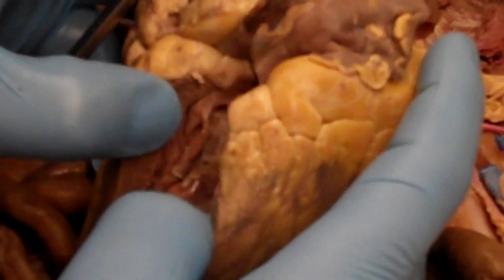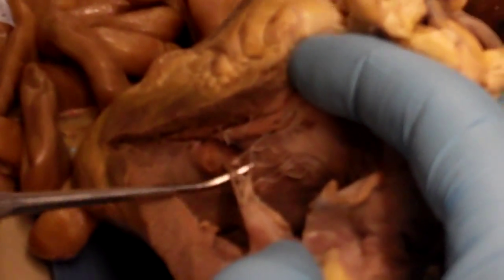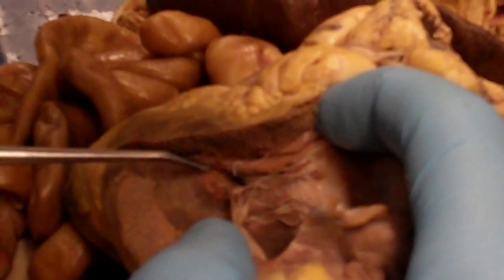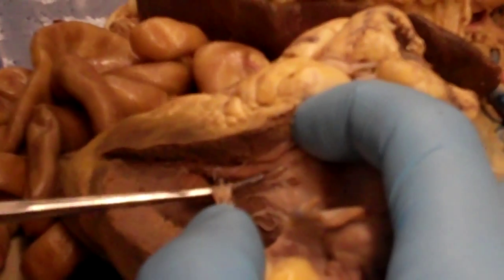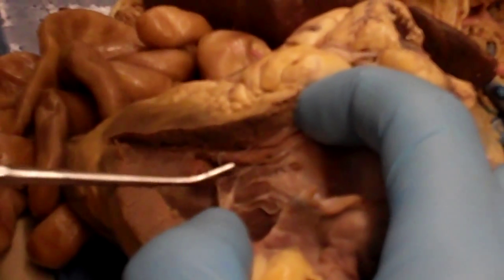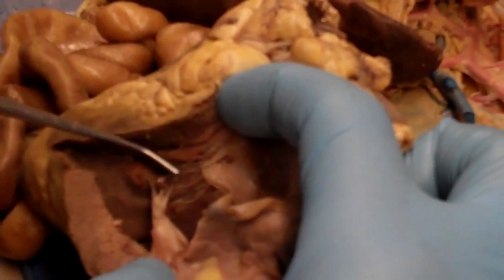Let me just see if this side's any better. Yeah, this one's a little better. So we can see the valve leaflet right here. We can see the little strings, which are the chordae tendineae, and you can see how they're coming off of this little bump that's sticking out of the wall of the ventricle. That's going to be a papillary muscle right there. So it's only found on the right ventricle? You can see them in left and right. They're more associated with the chordae tendineae than anything else. So you'll see the wall, you'll see this little lump of muscle, which is the papillary muscle. Coming out of it are going to be the chordae tendineae, and then they should attach to the valve leaflets. So these are all chordae tendineae right there.